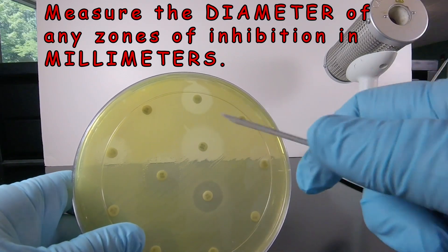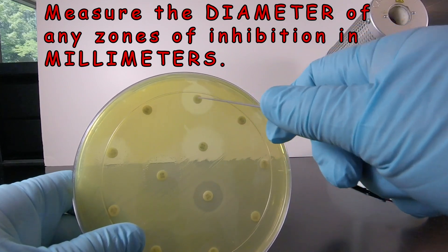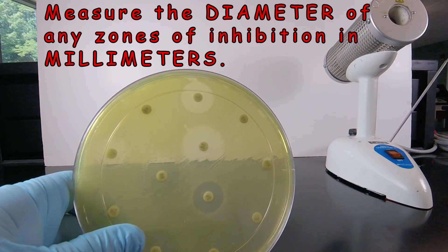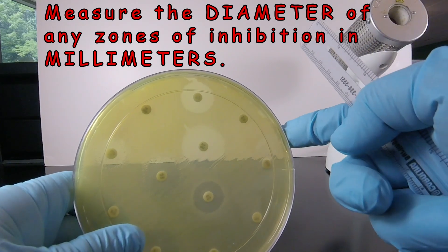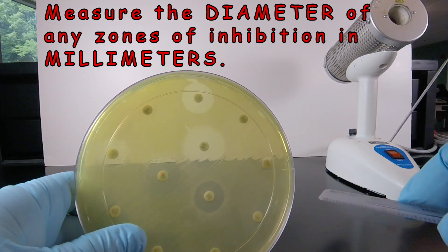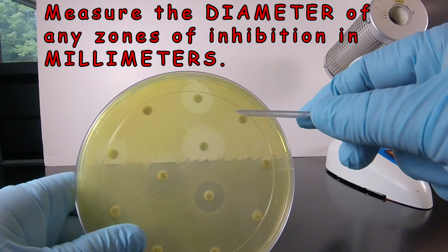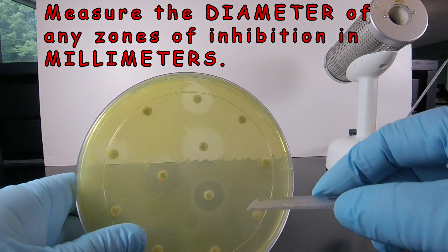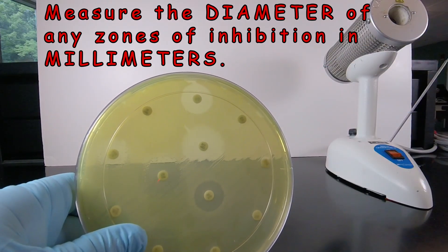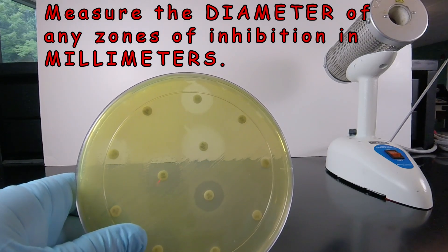Diameter is from one edge of the circle to the other edge through the center. Taking a quick look at this plate of Pseudomonas with its characteristic green water-soluble pigment, several of the antibiotics have no zone of inhibition — the bacteria are growing right up to the disc. That bacterium is automatically resistant to the antibiotic.